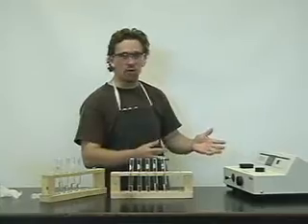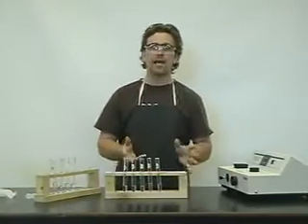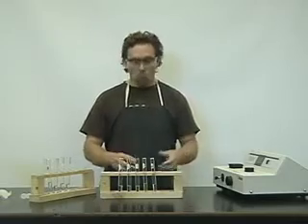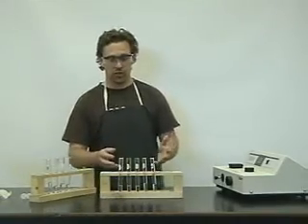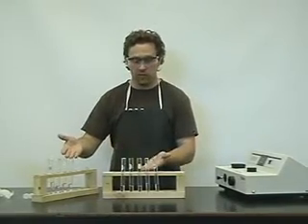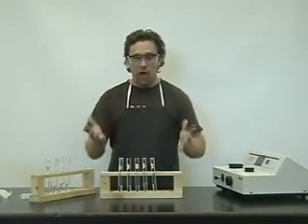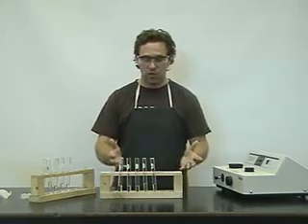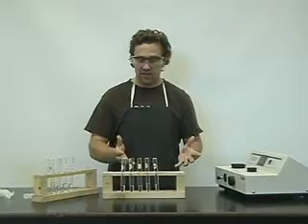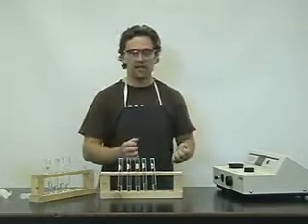Once we take the absorbance value, we can use that to find the concentration at equilibrium. Once we know that concentration, we can find the concentration of the respective ions that we've used. From the results gathered, we'll see if there is any relationship that exists between the 3 ions.